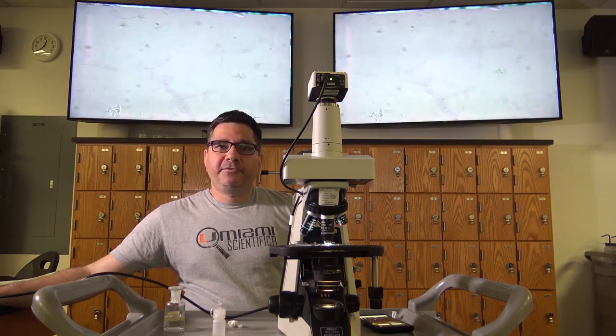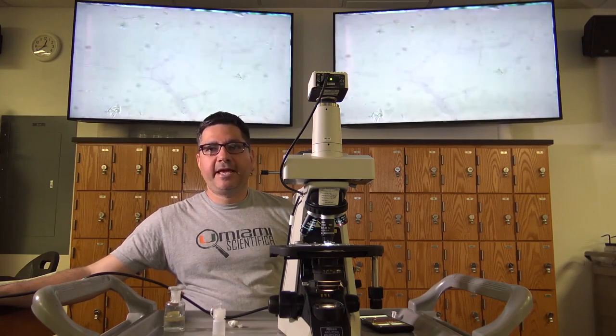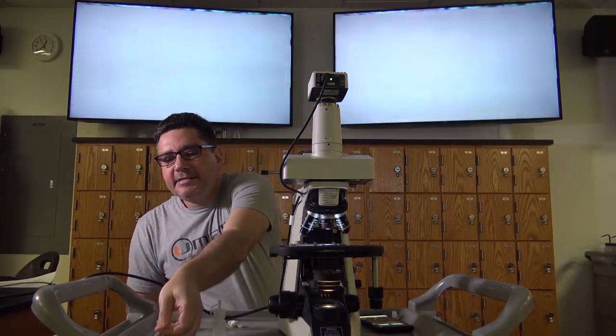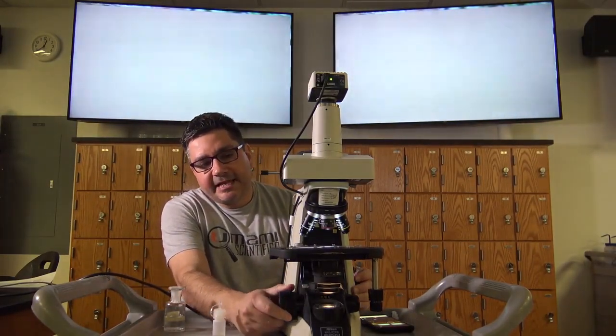You may now show your specimen to your TAs for their signature. After this has been done, return your scope's objective to the 4x, being careful not to pass the 40x through the oil. Remove the microscope slide from your scope and place it to the side. Using the coarse adjustment knob, rotate it so that the stage moves down.